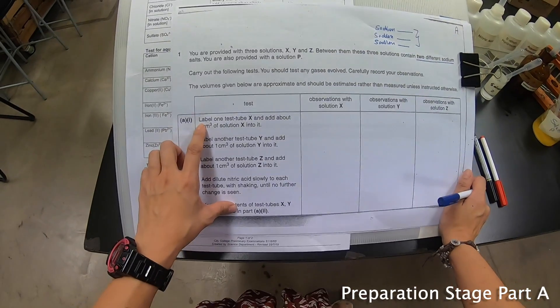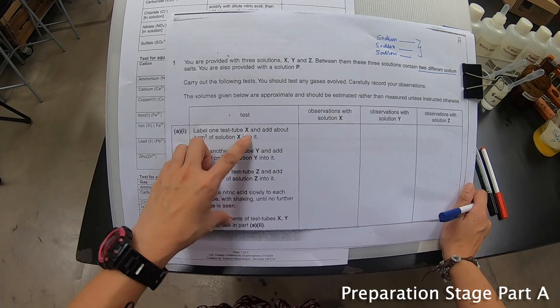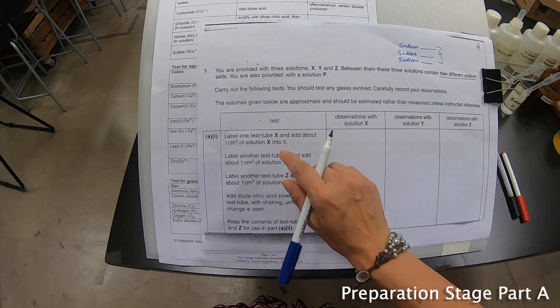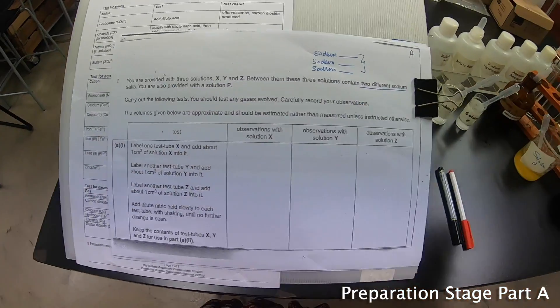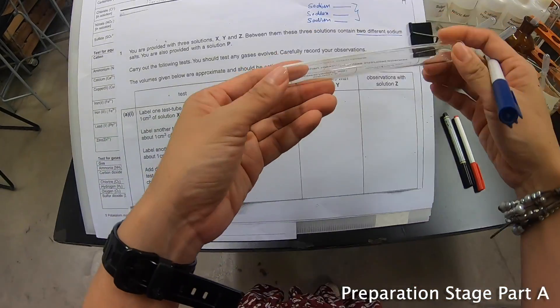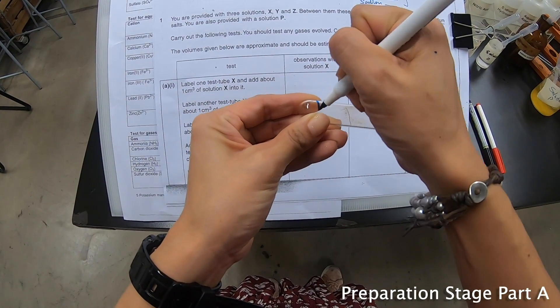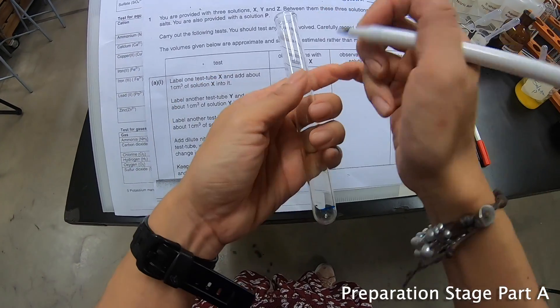Part A, part 1: label one test tube X and add about 1 cm³ of solution X into it. So we're going to label it. Let me take one test tube — 1 cm³ — and label it X.